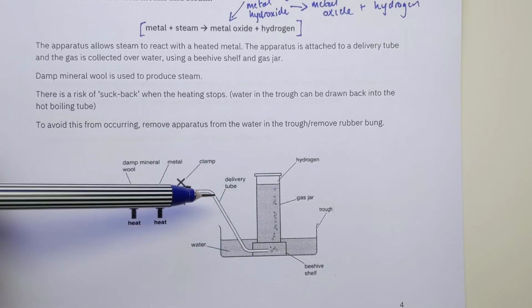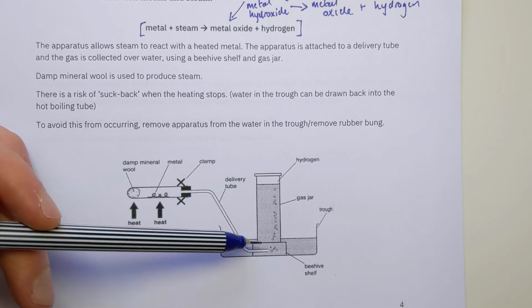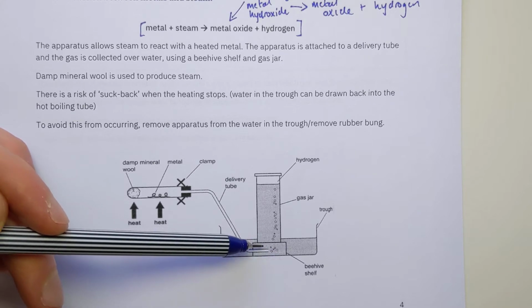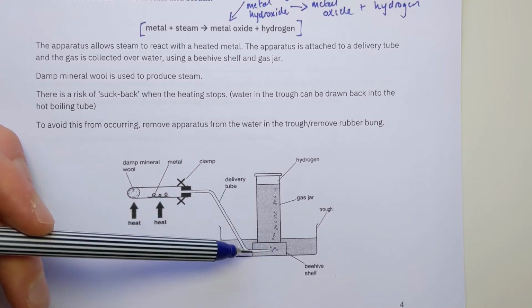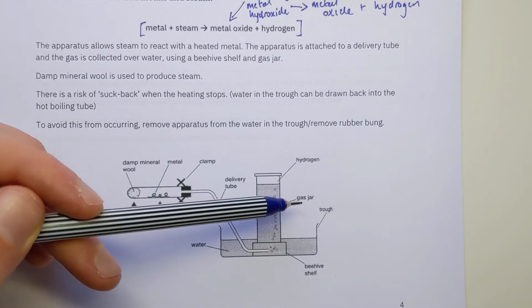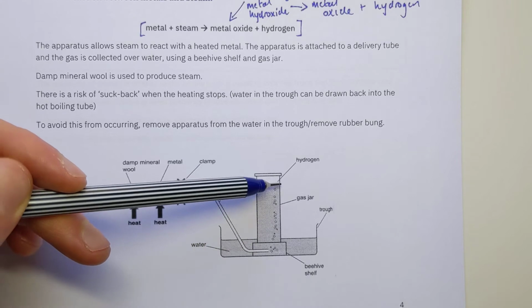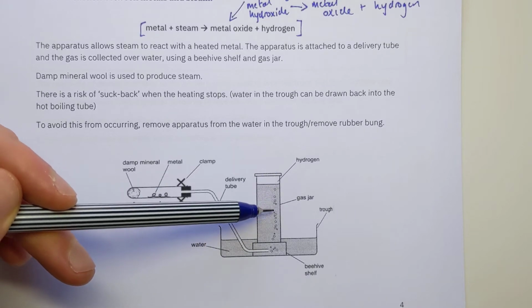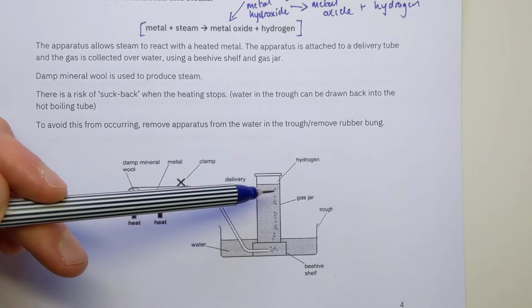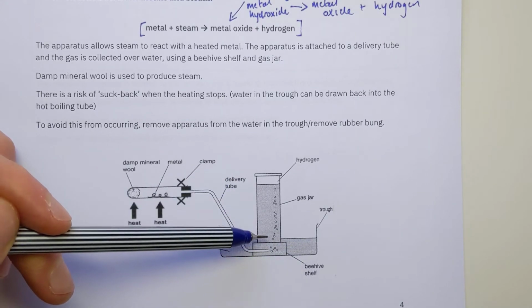So the setup we have is this. We go into a beehive shelf. Now a beehive shelf is just like a ceramic pot with a hole at the top, and just provides like a wee stand for this jar to go on top. The proper name for this jar on top is called a gas jar, because it's for trapping gases, and it's important that you draw it with water filled up near the top at the start, then it's gradually going to drop as the gas bubbles in. We put this all in a trough of water, just keep it all sealed and stop any air getting in.